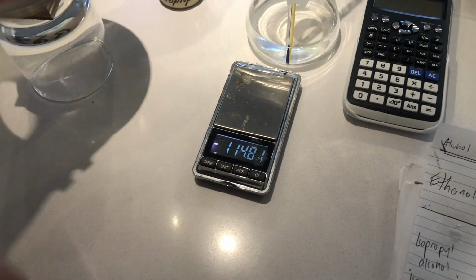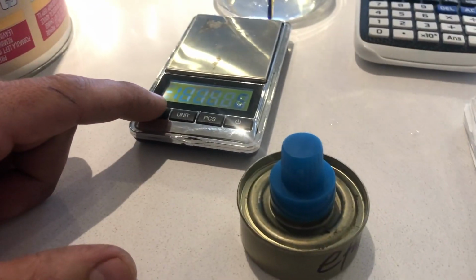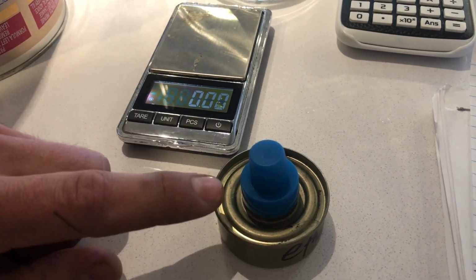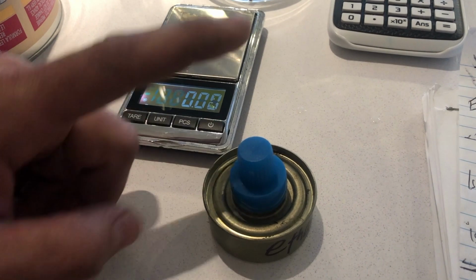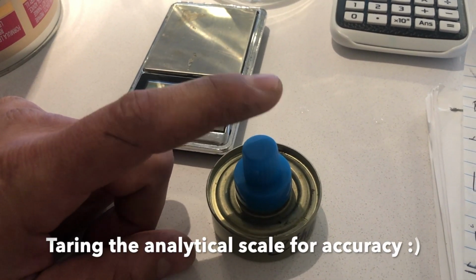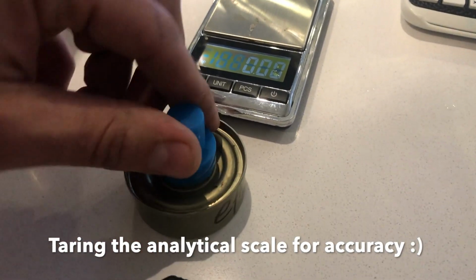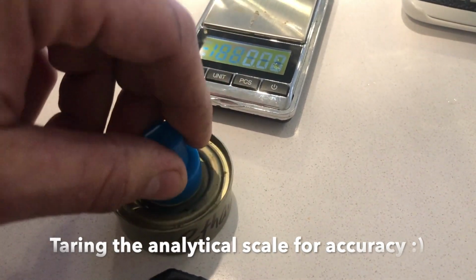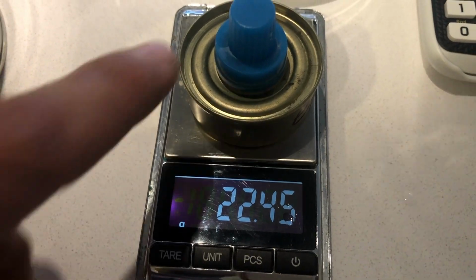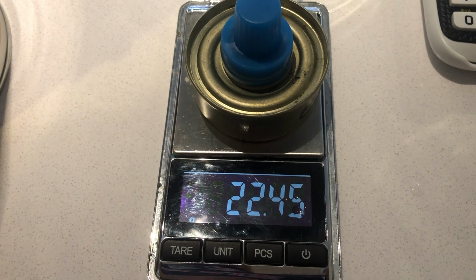Okay, so here's the ethanol. We need to keep track of our initial measurement. First, tare the flask, because it was tared to account for the glass, and this is not using the glass. You need to also take into account, initially we used the cap, so when we reweigh it at the end, we'll make sure to put the cap back on. The cap's there to help prevent any loss by evaporation, which would also affect the mass. So we're not going to deduct the mass of the container, the burner, and that's not necessary. You'll see why later, I hope.